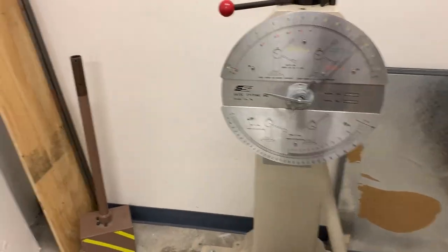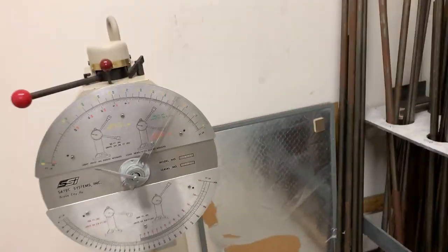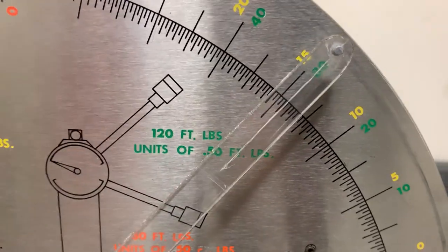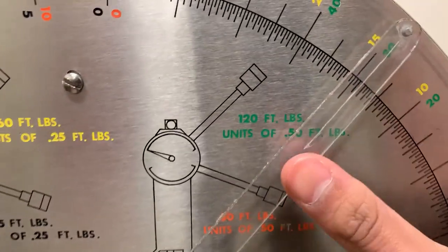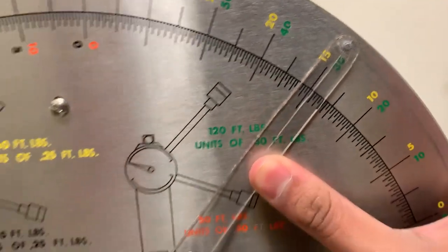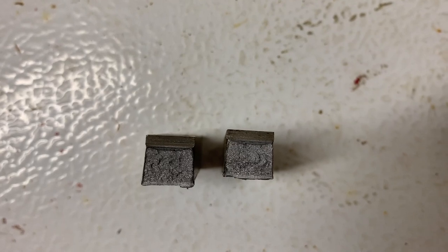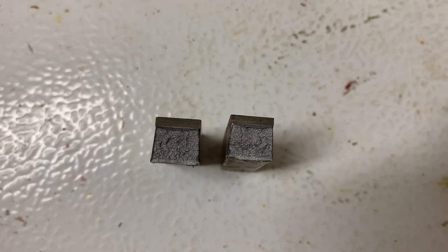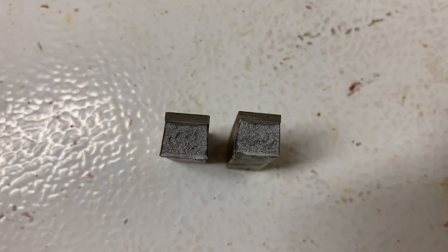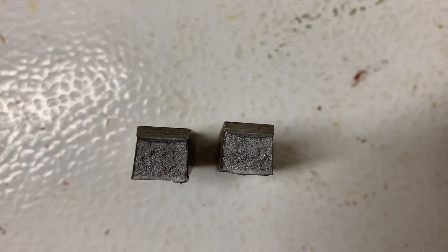Once it's broken and stopped, we can go pick up our sample. Put the pin back and let's pick up our sample. This is how much energy it needed to break — we're reading the yellow needle, which is about 12.5, almost 15 foot-pounds needed to break this sample at room temperature. We can measure the deformation, record the fracture energy from the pendulum reading, measure the lateral expansion, and also do the fracture appearance test to determine visually what percent ductile and what percent brittle our sample is.